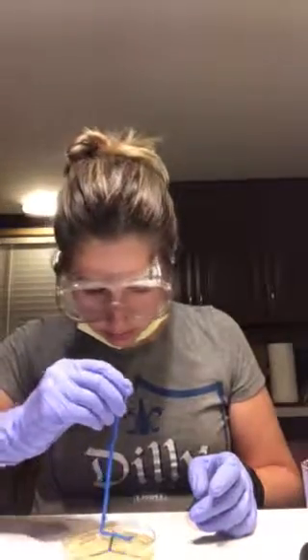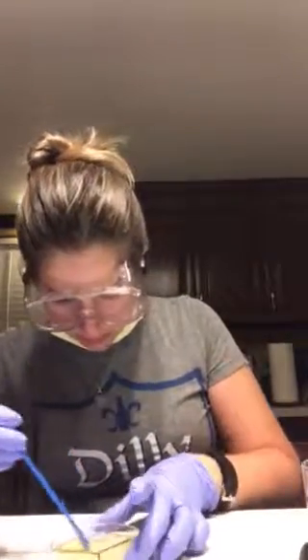We're gonna flame this up again, seal it, and then turn it off. Now we're gonna get the L-shaped spreader, which would be this thing here. We will not touch the bottom part because it is sterile — we can only touch the top. Then we will spread the broth evenly so that the entire plate is coated with an even layer of broth.